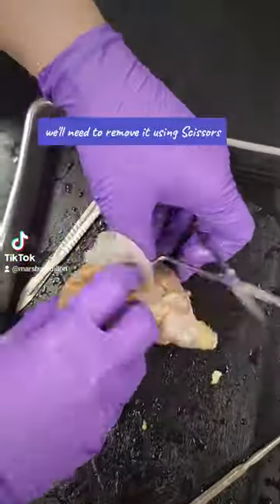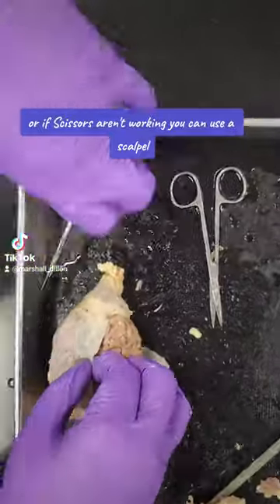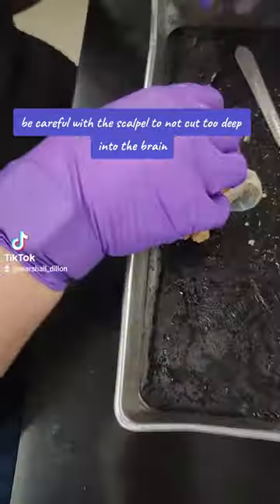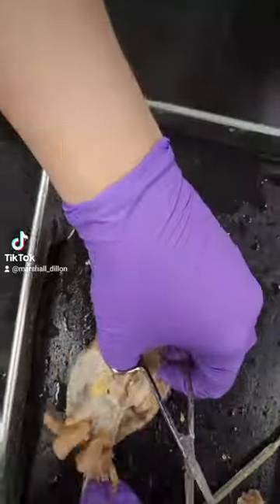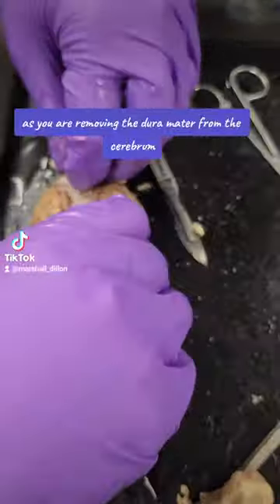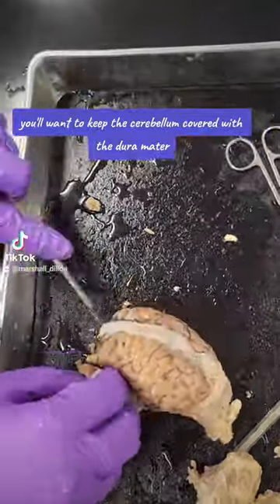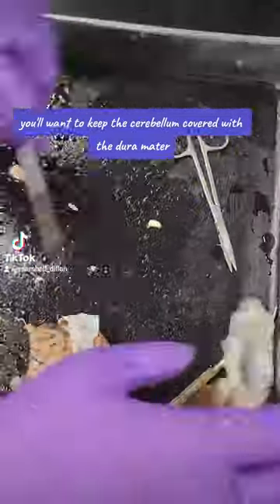We'll need to remove it using scissors, or if scissors aren't working, you can use a scalpel. Be careful with the scalpel to not cut too deep into the brain. As you are removing the dura mater from the cerebrum, you'll want to keep the cerebellum covered with the dura mater.